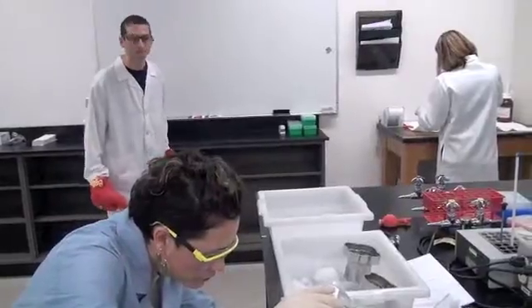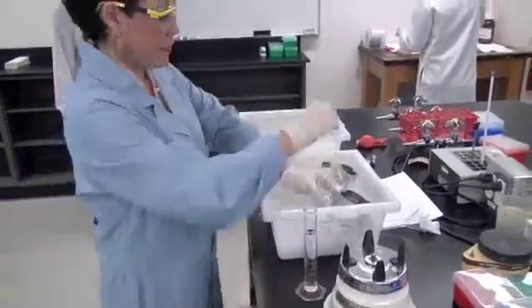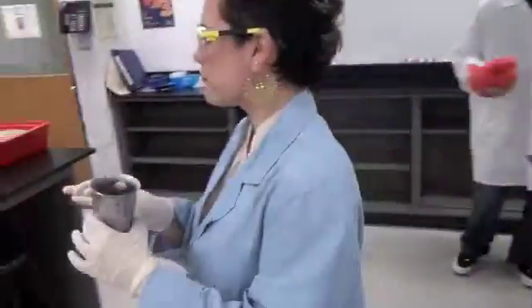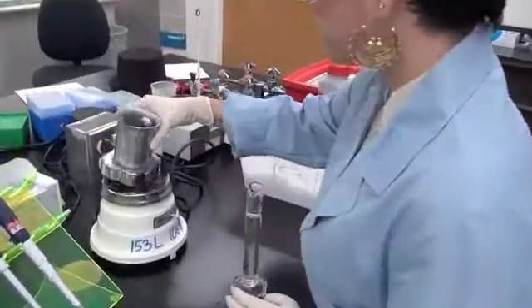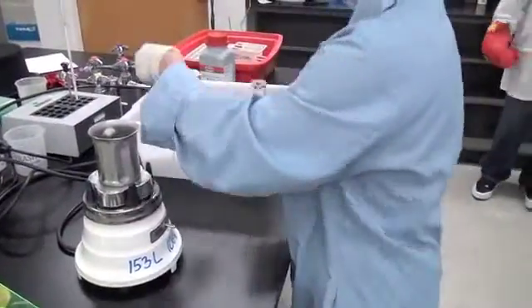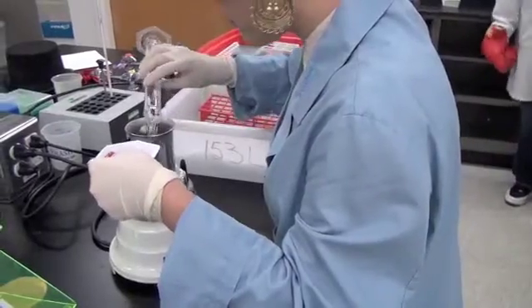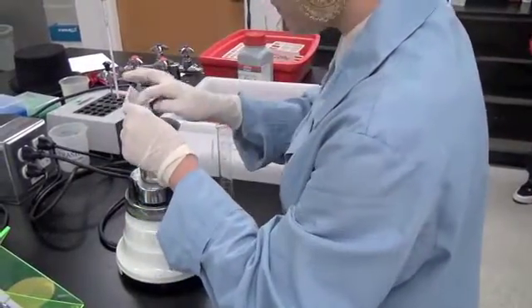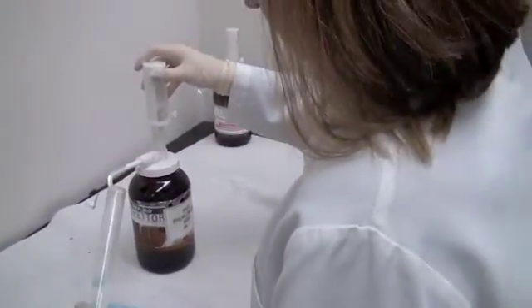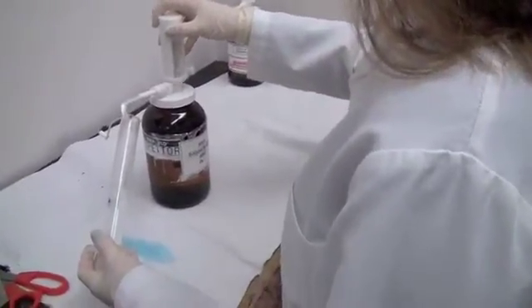Well, Ionic Biochemist Dicer is really on top of this. She's obtained her ice-cold phosphate buffer and has moved ahead by grabbing her chilled blender cup and getting her next step ready. Looks like Biochemist Dicer is ready to do some more shopping. Oops, I meant chopping. Ha ha ha, I think you mean Biochemist Dicer. But shopping is absolutely correct, since Dicer is all money. Challenger Curate is still pumping out 50 mils of room temperature phosphate buffer. I wonder what will happen to Challenger Curate's yield and purity.